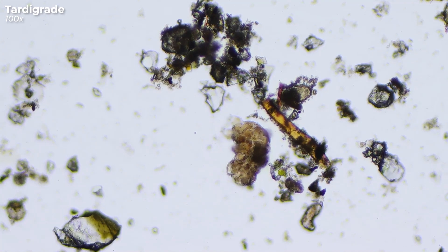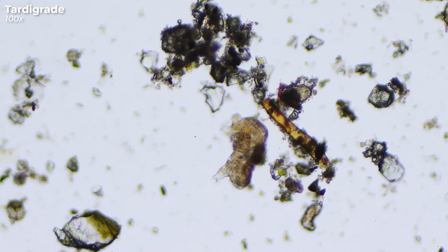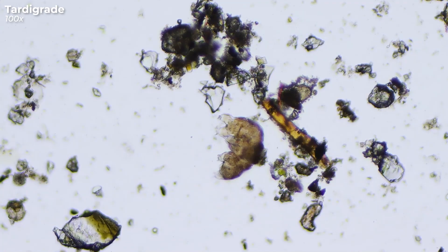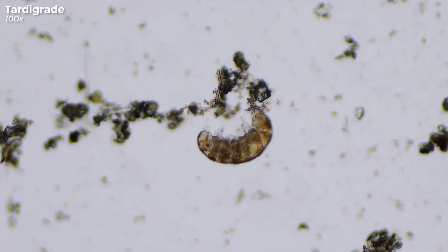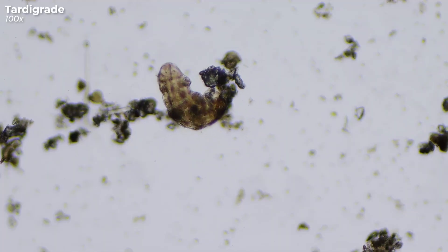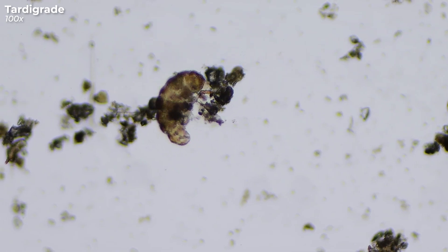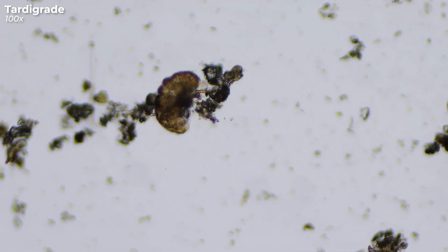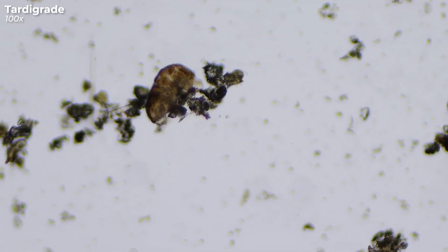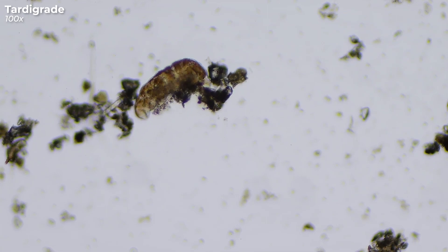Most freshwater tardigrades are white or colorless. The color of some terrestrial species can vary — some are pink or green, yellow, purple, black, or, as in our case, brown. The coloration is either caused by pigments in the outer skin, the cuticle, or is dependent on the digested food.